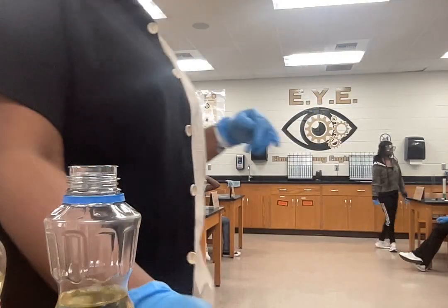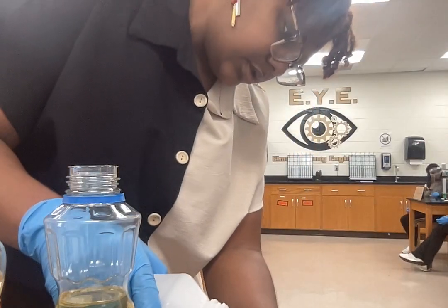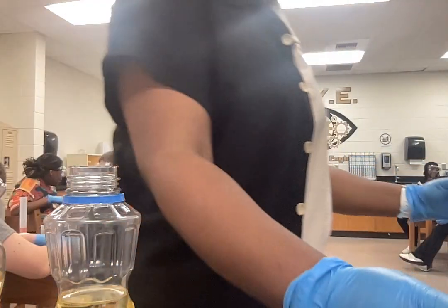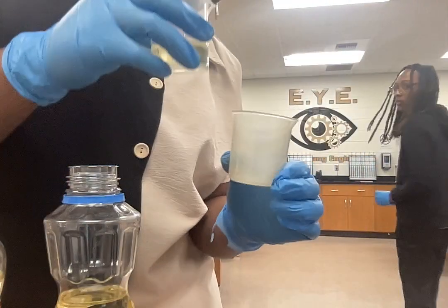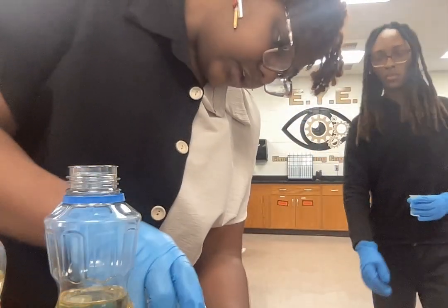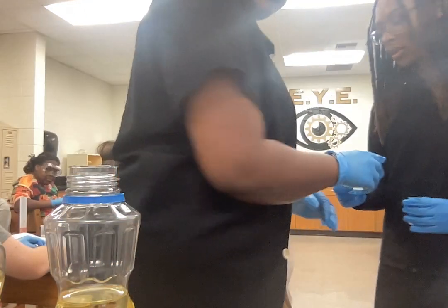Oh, that's a little too much. Let me go ahead and have Bozeman's group with y'all's graduated cylinders and things like that. All right, there you go. So I did give them a little too much. Hey, Jalen, come back because I did give y'all a little too much. All right, there you go.